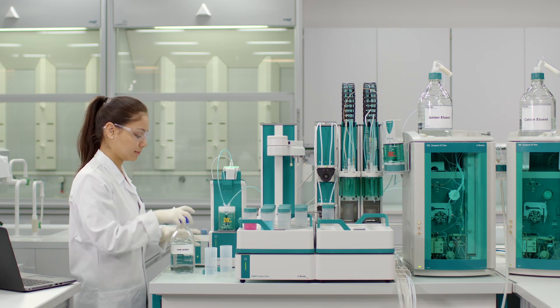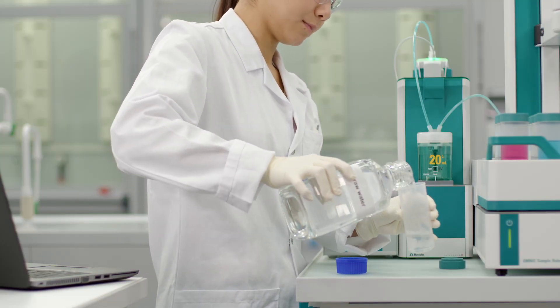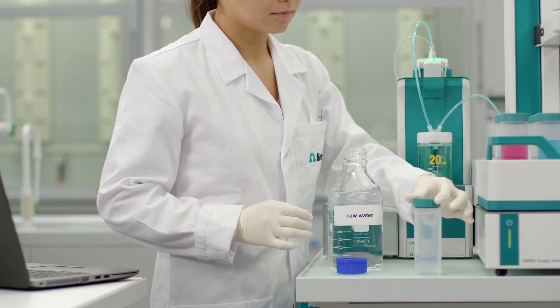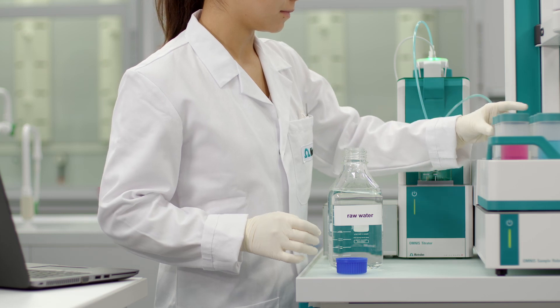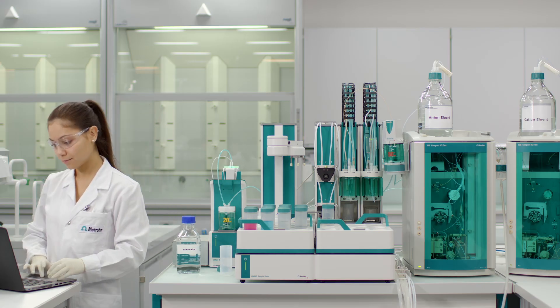To begin, just pour the sample in a beaker and place it on the rack. Then enter the sample data and press start.